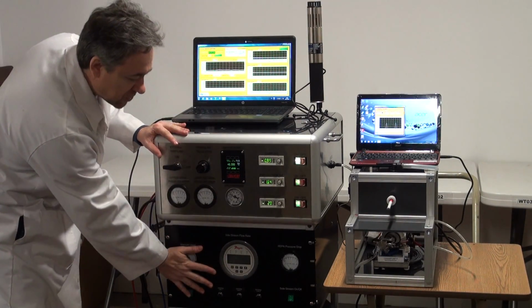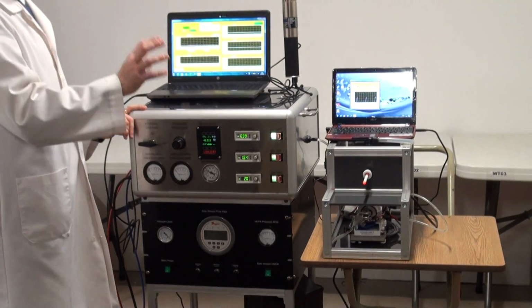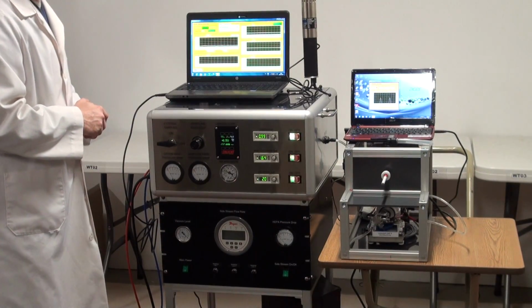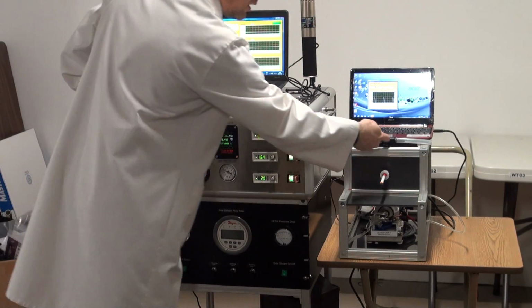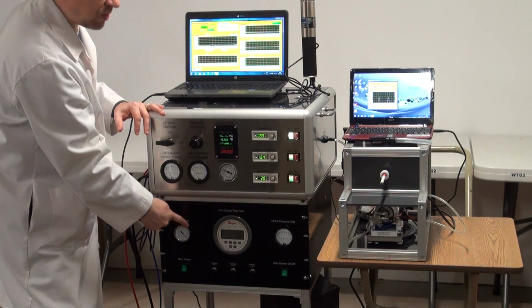And at the bottom of the siphon, we see another device, which is a mixer of side stream and mainstream smoke. This is a particular design for a large smoke generator, but also for the single cigarette smoke machine. Here we can connect a module of side stream collection, which can then be mixed with the mainstream.